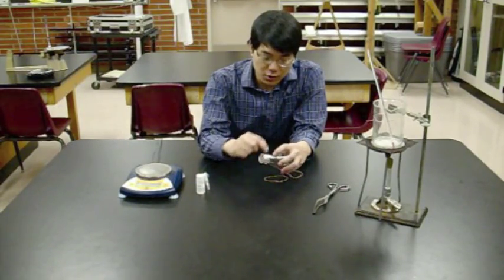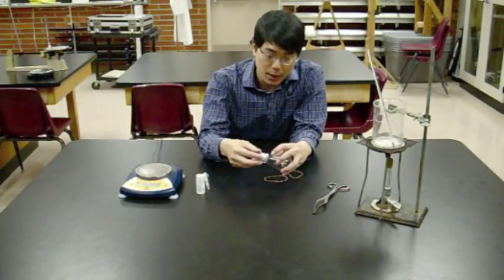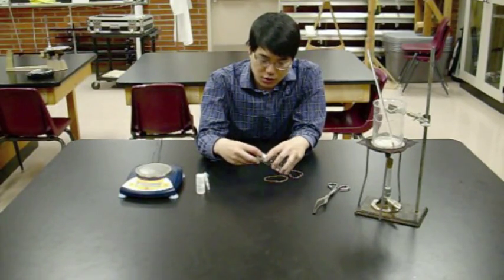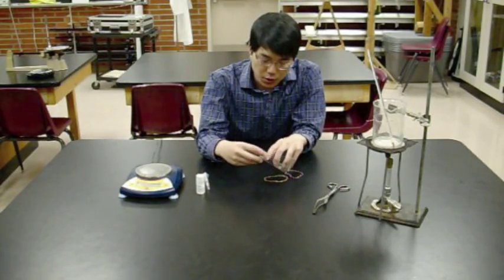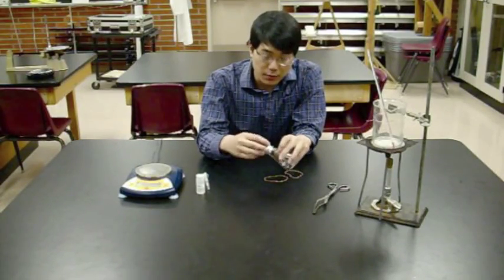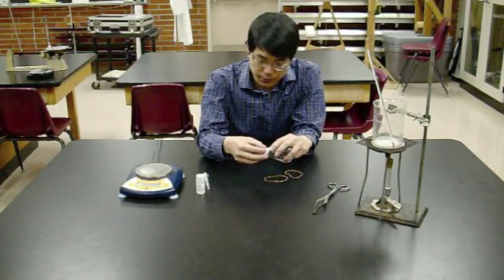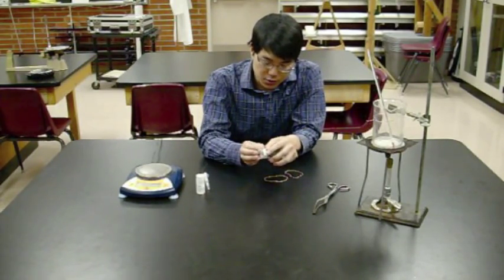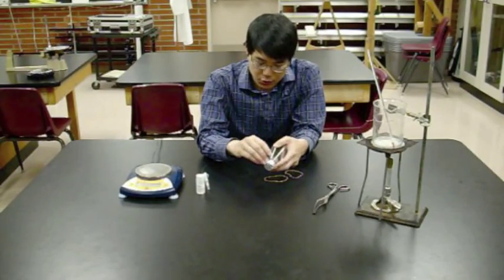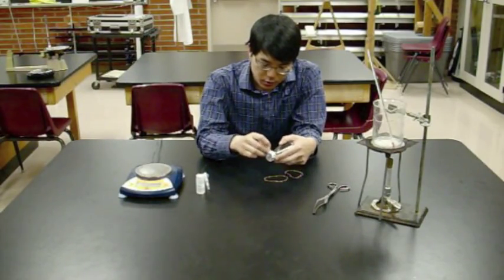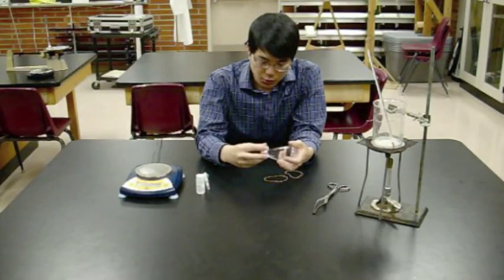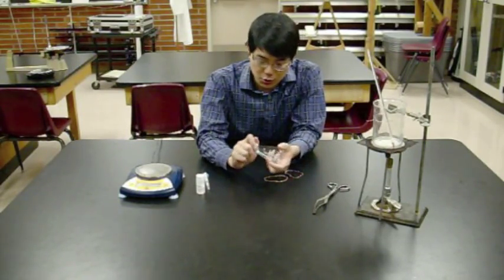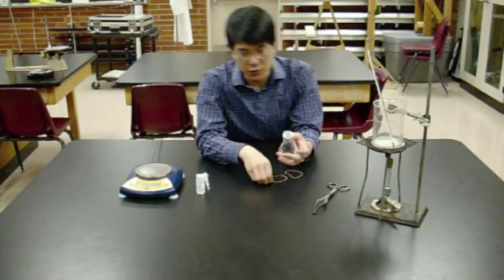The corners of the aluminum foil will extend down much farther than needed, which invites water to get trapped and cause errors. Take the corners and fold them up so they're at the same level as the rest of the foil. You don't have to be super accurate, just make sure the corners don't hang down too much.